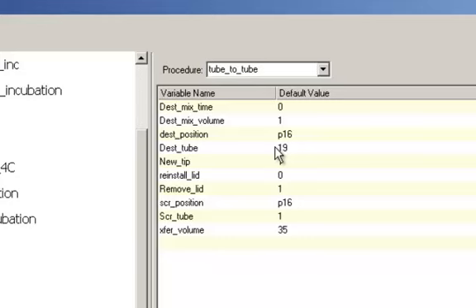In our situation, it always stays at P16. This is just used for the cold block making the master mix. And you also specify the destination tube and the source tube and transfer volume. So basically you're just passing it those variables. It's going to do the transfer. If you tell it to mix, it'll mix at the specified volume. The procedure also selects the appropriate tip.